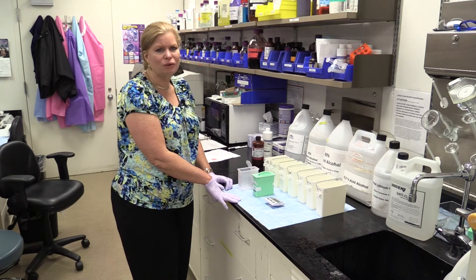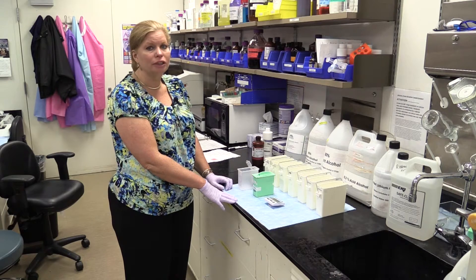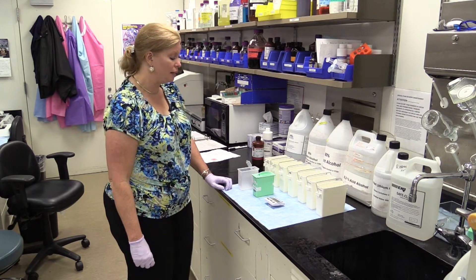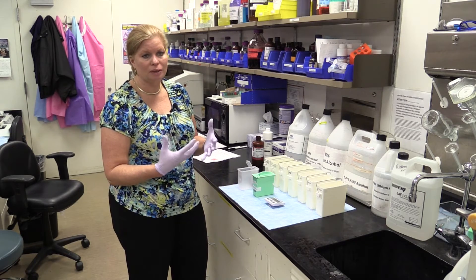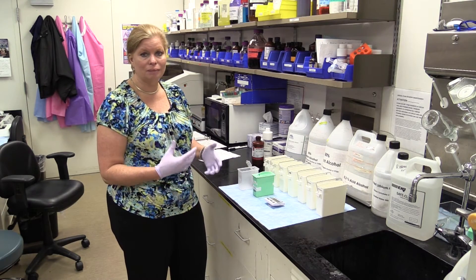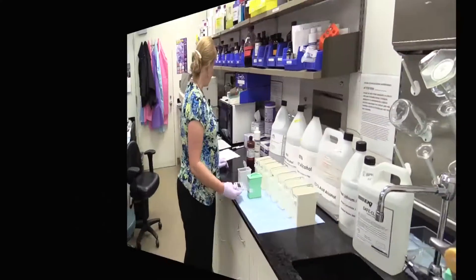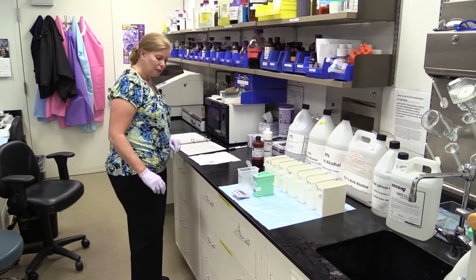The main purpose is just to give you an idea of the nuclei, but the main purpose of the stain is to show the collagen and show that background yellow, and really distinguish the collagen in red — and then later under polarizing filters to show the different polarizing color changes. I'll go ahead and go for a half an hour since this hematoxylin is really fresh.